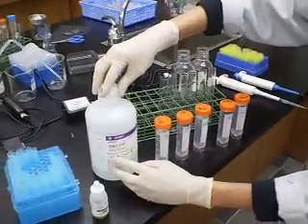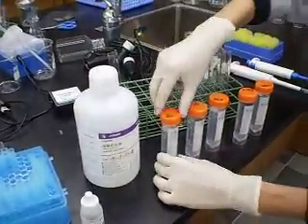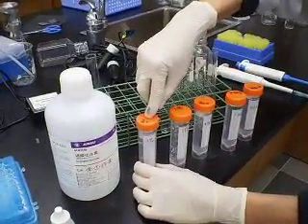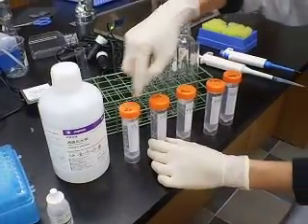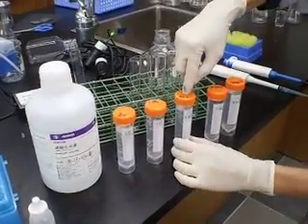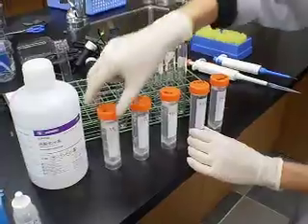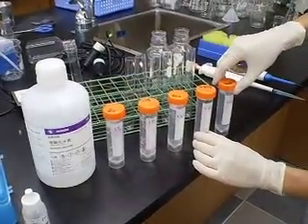Earlier on, I had 30% and I diluted it down to 3% of hydrogen peroxide concentration and I do a two-fold dilution. Two-fold dilution is 3% to 1.5 to 0.75 all the way down. So this is most concentrated and this is least concentrated. I prepared the same test tube size.